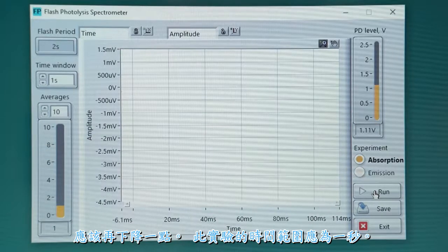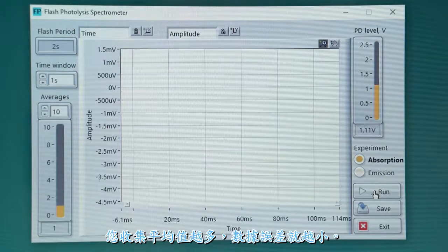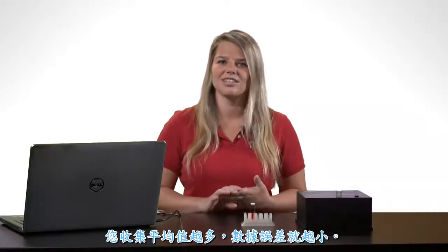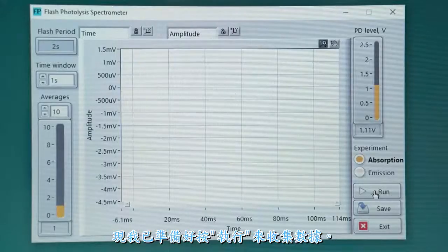The time window for this experiment should be 1 second. For preliminary runs, 10 averages should be sufficient. The more averages you collect, the less noisy your data will be. Now I'm ready to collect data by pressing run.